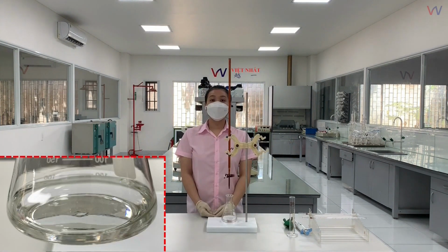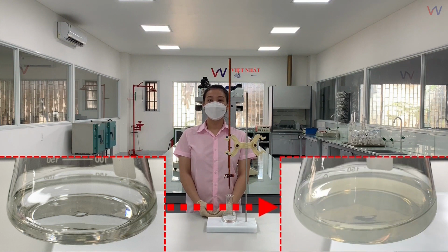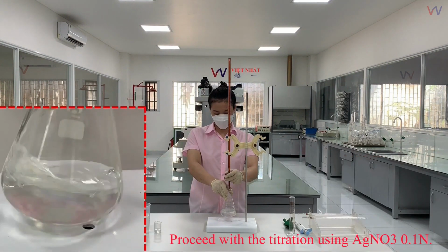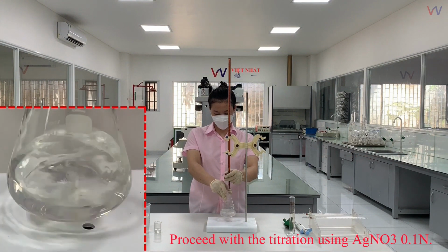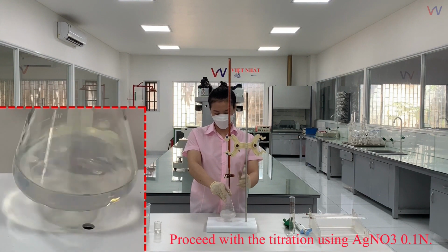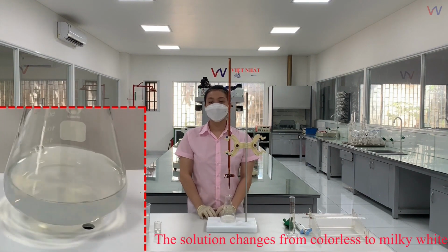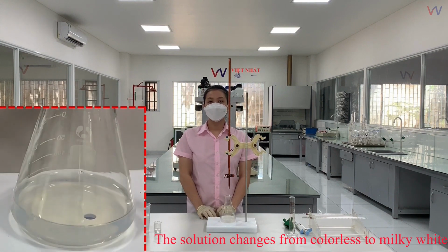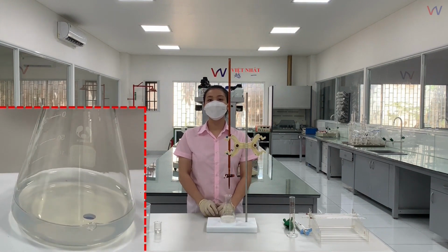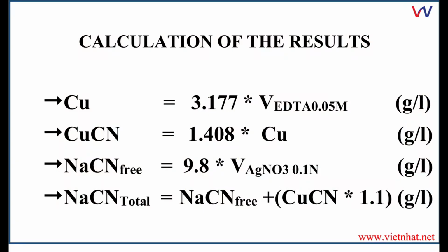We proceed to titrate the solution using a 0.1 N silver nitrate standard. When the solution changes from colorless to milky white, the endpoint is reached. Read the volume of silver nitrate 0.1 N used and proceed with the calculation of the result.